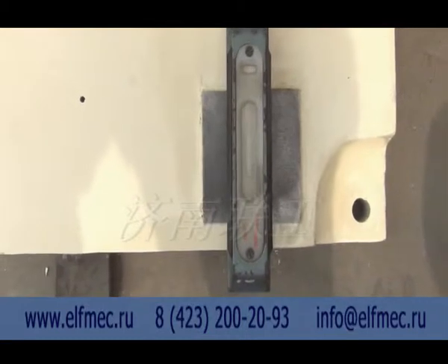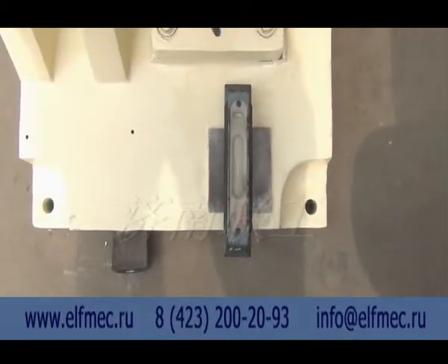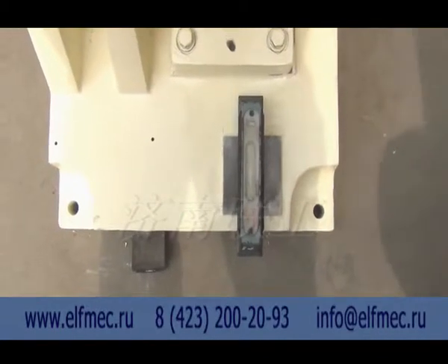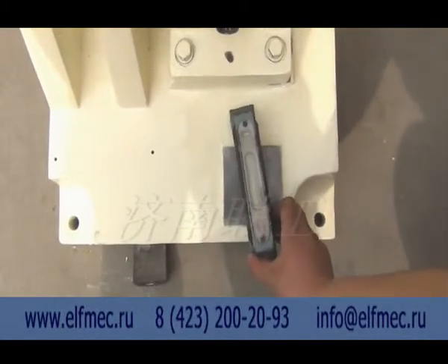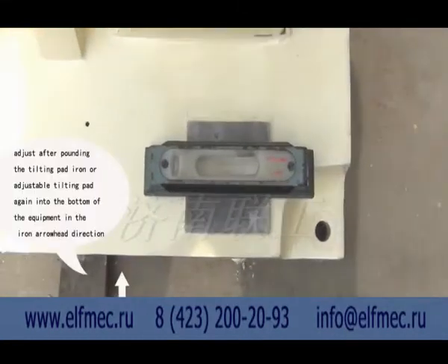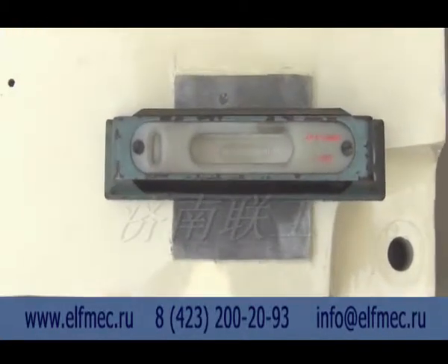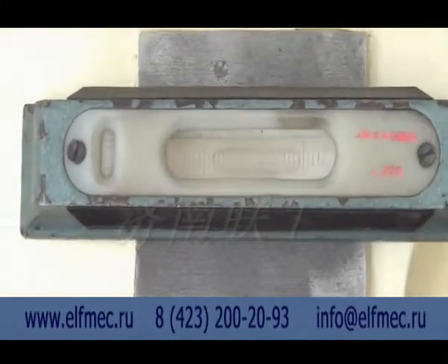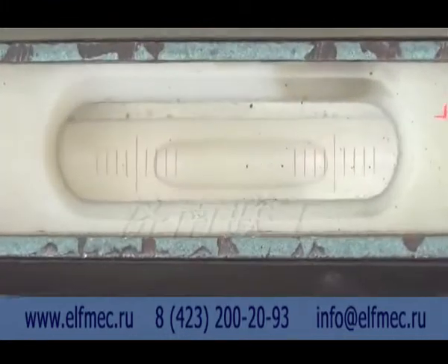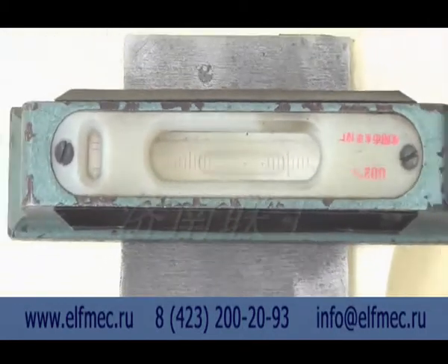Put the gradient on the base surface of the equipment. Adjust the pad iron at one end to make sure that the gradient bubble is in the center. Then adjust the gradient by 90 degrees and adjust the pad iron a second time to make sure that the gradient bubble is in the center. When the bubbles in both directions reach the requirement, the initial adjustment is finished.